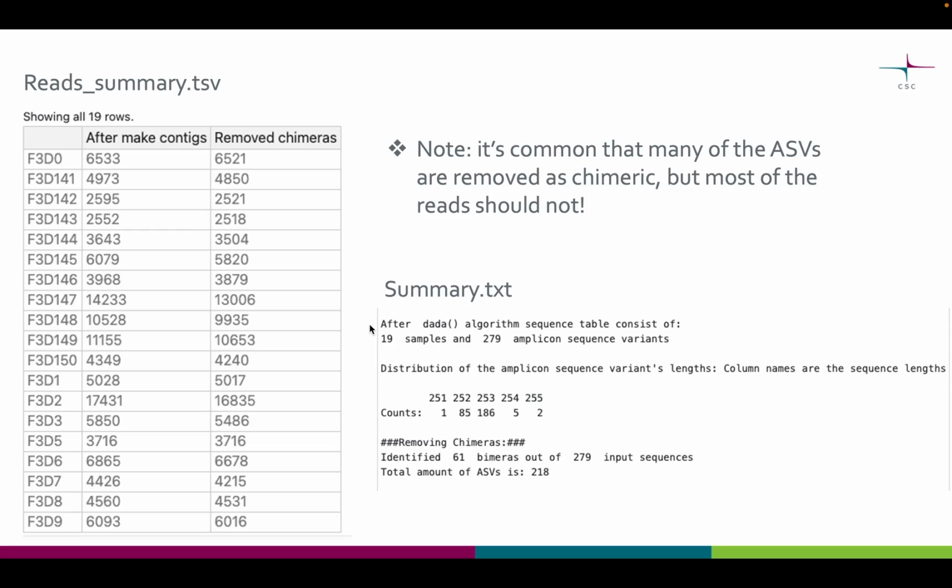And then in addition you will get the summary table, the one on the left side, to inspect how many reads remained after the chimera removal. Here on the left side, each row corresponds to a sample, and the first column shows how many reads there were before the chimera removal, and the other one after the chimeric sequences were removed. Note that it's quite common that many ASVs are removed as chimeric, but most of the reads should not be. That means there might be quite many chimeric ASVs, but those are very low abundance. Most of the ASVs removed as chimeras have an abundance of just a few copies.